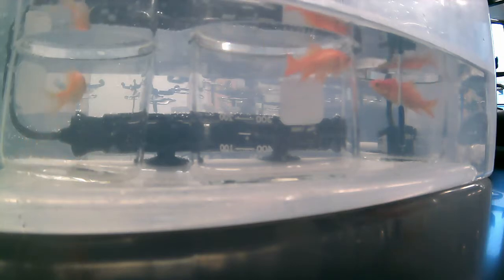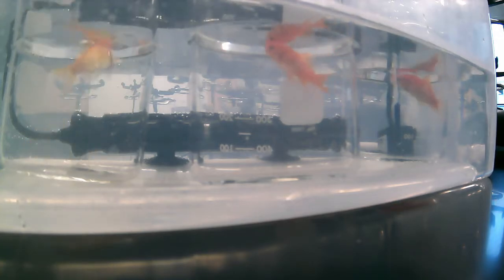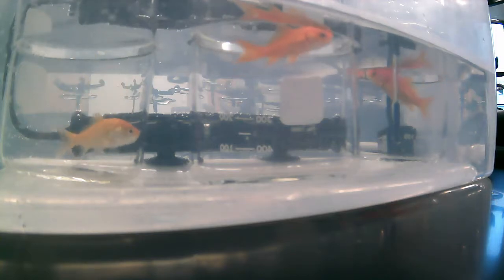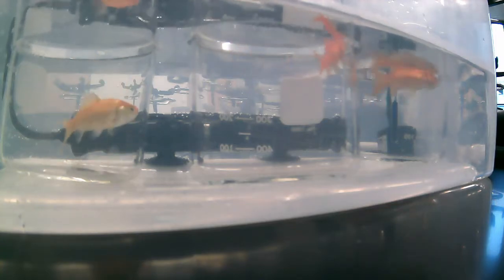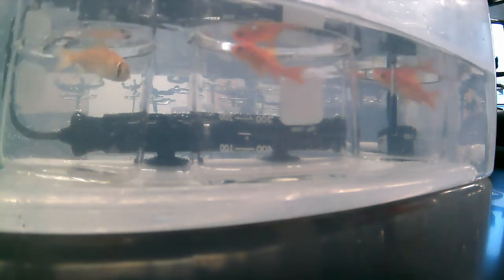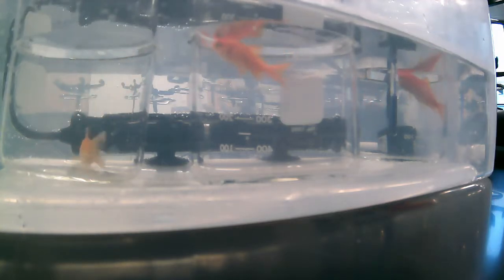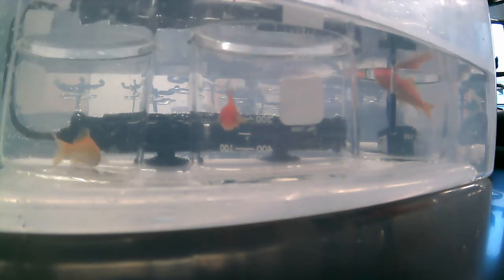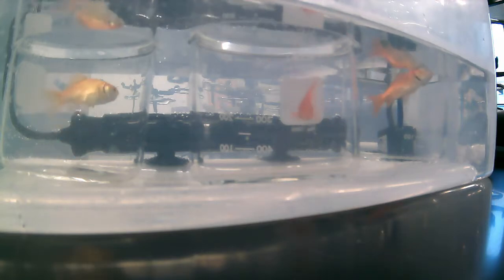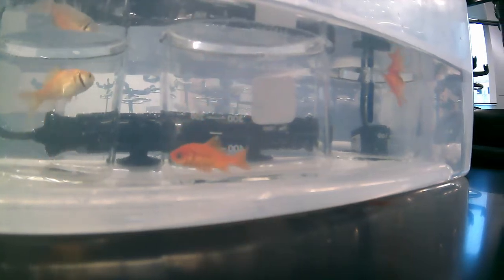The temperature of the water has gone up. We started with a temperature of 20.5 degrees centigrade, and now we are at 34.3, so they're approaching that point at which the critical thermal maximum will be reached, and at that point they'll lose locomotor control. Again, that's an ecological death point, and we will take them out and put them back in their original tank at the original temperature, about 20 and a half degrees or so, and that'll allow them to come back and recover fully from the experience.